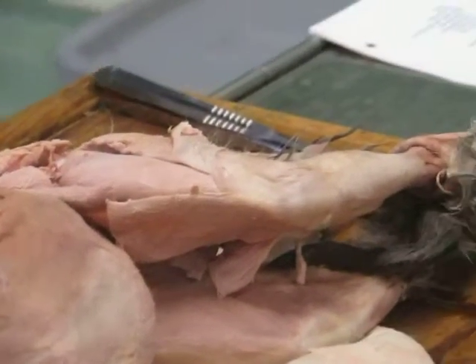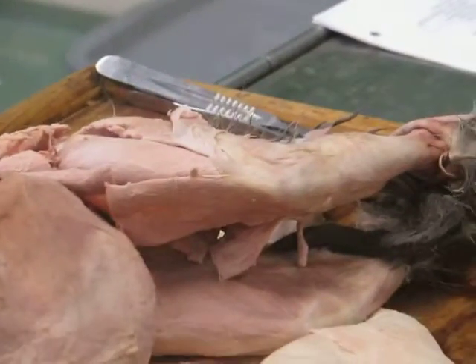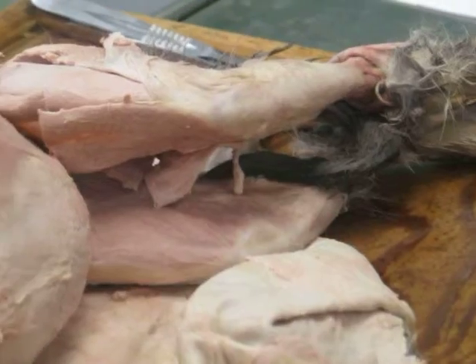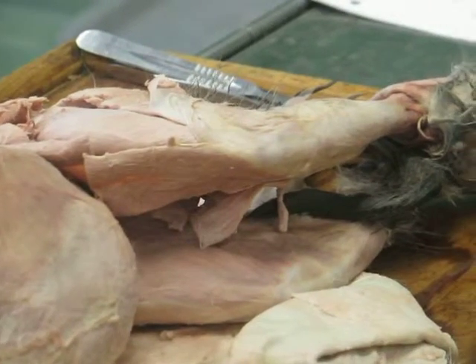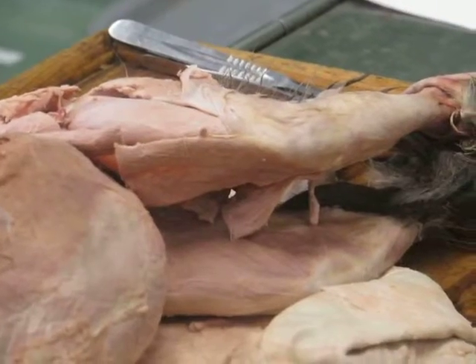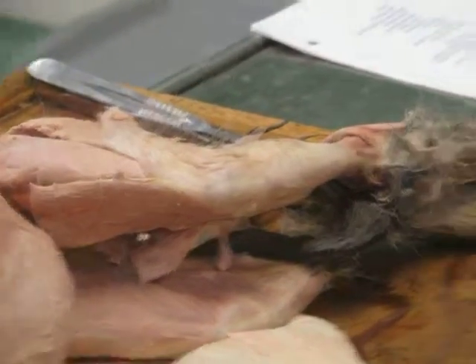Like they're really well dressed? Okay. And this is the tailor's muscle, because in humans, this muscle comes from the crest of the ilium, crosses the front of the thigh, inserts into the distal inside part of the knee, medial part of the knee. And so when it acts, it basically protracts the thigh, flexes the knee, and laterally rotates the hip. And so it brings your leg into kind of a cross-legged position. And apparently tailors always used to sit on the ground sewing their stuff in a cross-legged position. So the tailor's muscle, sartorius.